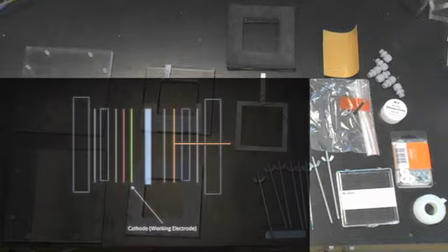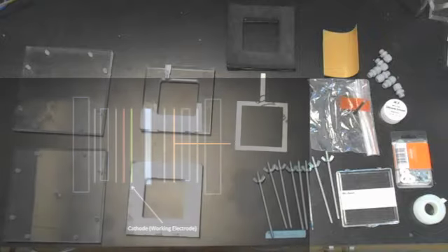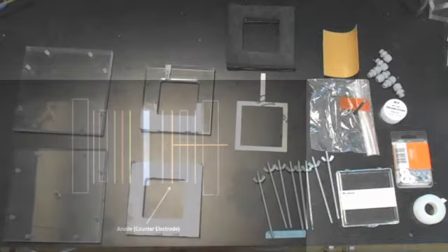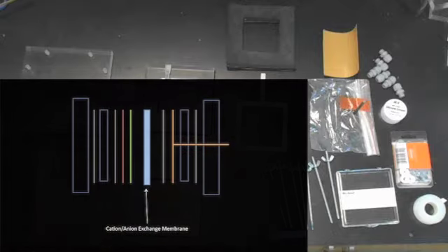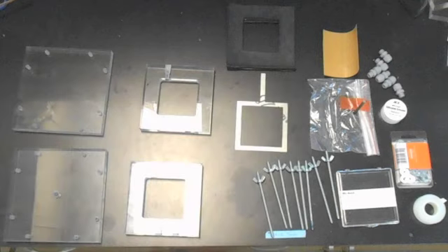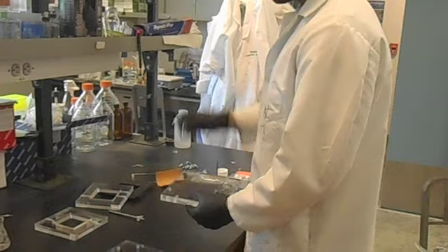Here we have our carbon felt electrode which will serve as our cathode. A titanium coated with iridium oxide will serve as our stable anode. We cut a cation exchange membrane which will rest between the two half cells. On the right, we have our accessory parts: nylon glands, silicone grease, washers, and Teflon tape.